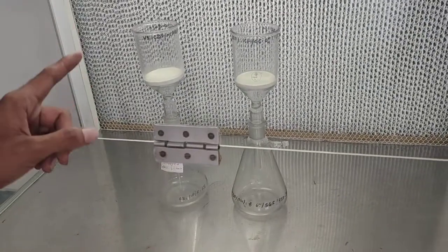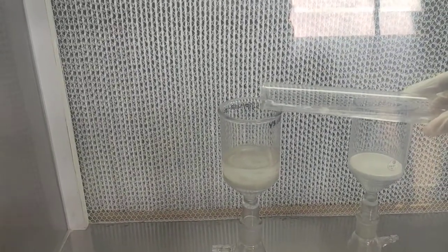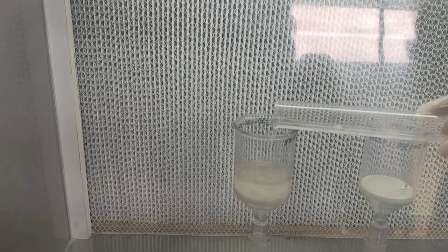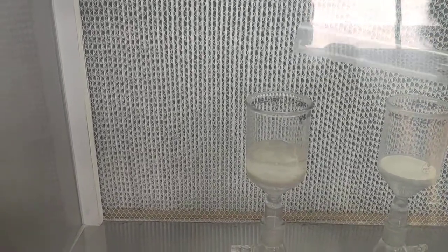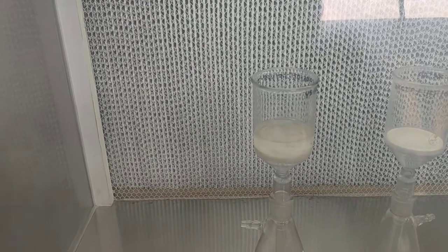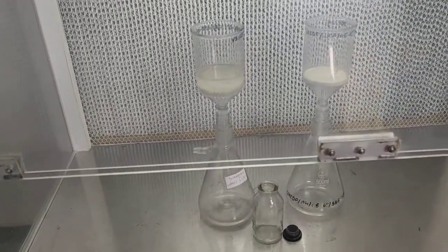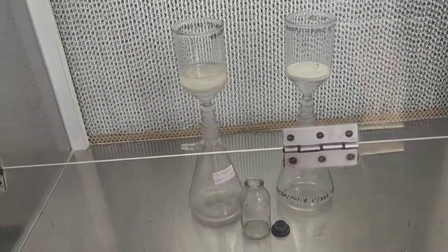We will filter the preparation using a sintered glass filter. Water for injection, dextrose solution, and sodium chloride solution are all filtered through this sintered glass filter with a 0.2-micron pore size, which ensures the injectable preparation is microorganism-free and particulate-free.